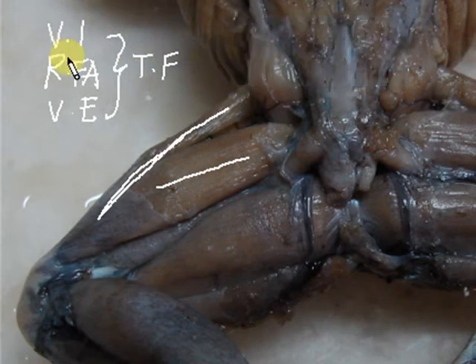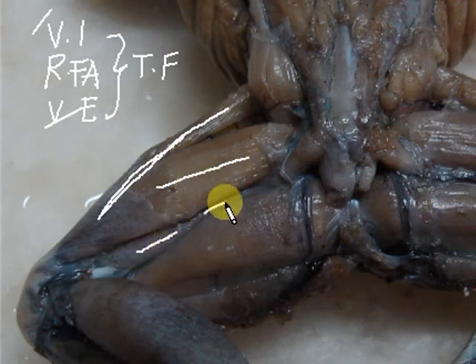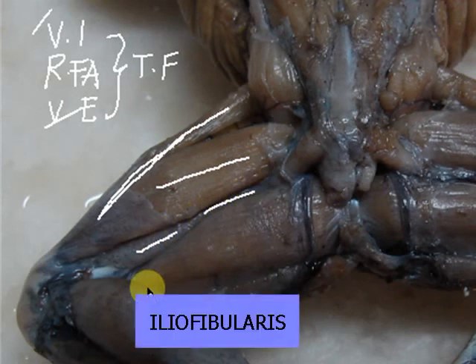So triceps: tri means three, ceps means head, femoris because it's close to the femur. So triceps, the muscle that has three heads, and the three heads would be your vastus internus, which you saw ventrally, the rectus femoris anticus, which you will see anteriorly, hence anticus, and then the vastus externus. Those are the three heads of your triceps femoris.